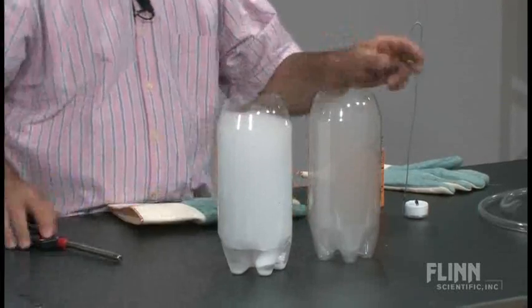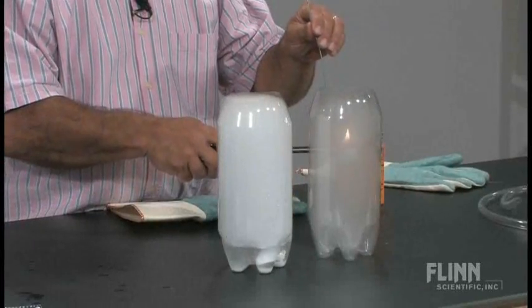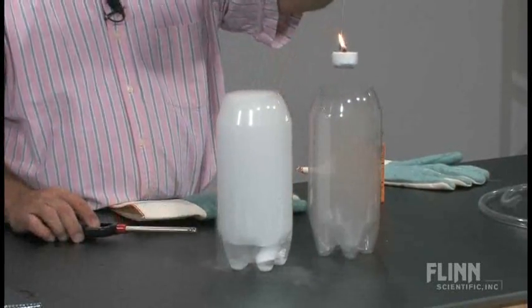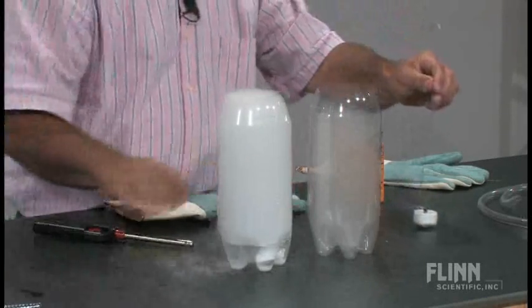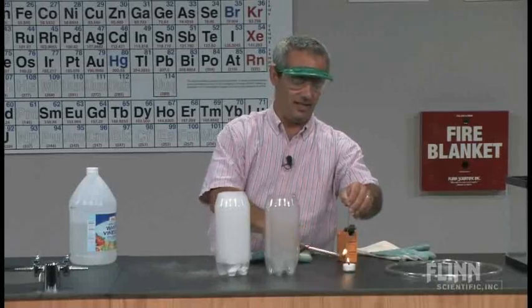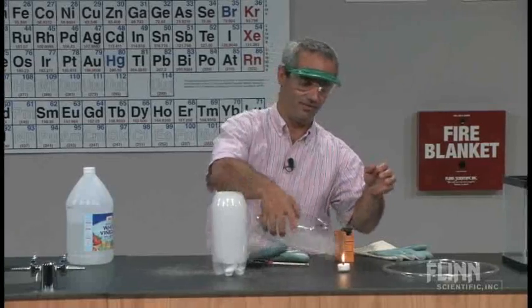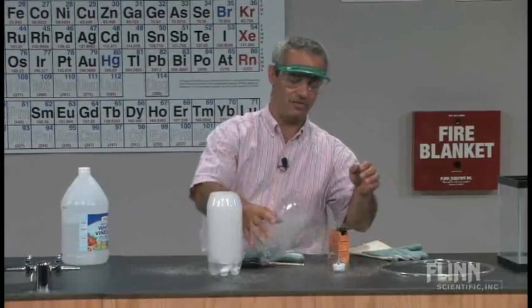I haven't really gotten rid of all the oxygen. But I have gotten rid of enough of it to put out the flame. So then you saw me dump it directly on the candle. There it goes. Poured it out.